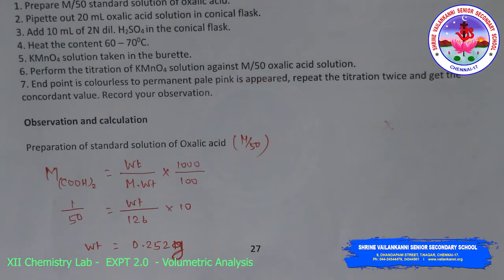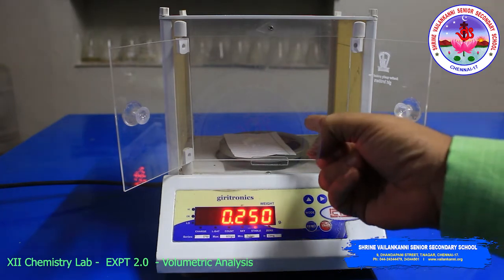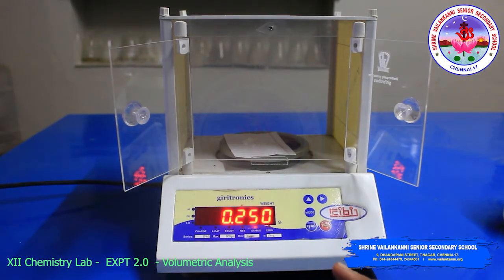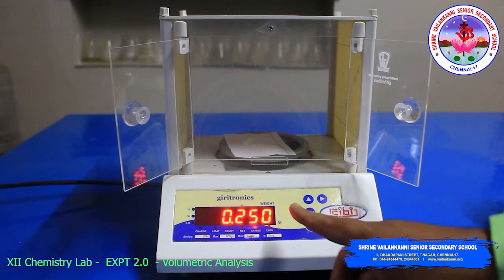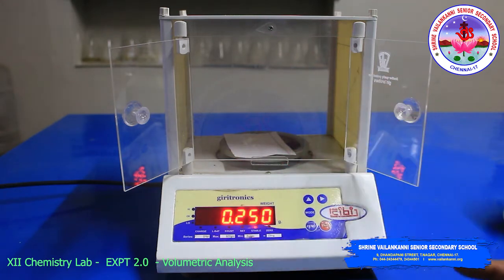Now we will start the titration. Here the substance, that is oxalic acid, we have to weigh 0.252 gram. Here it is 0.250, that is no problem. The third decimal is not a problem. So this is the accuracy of the substance.